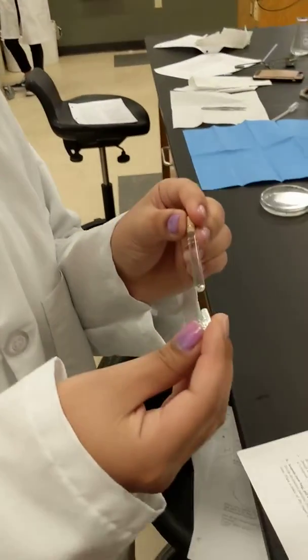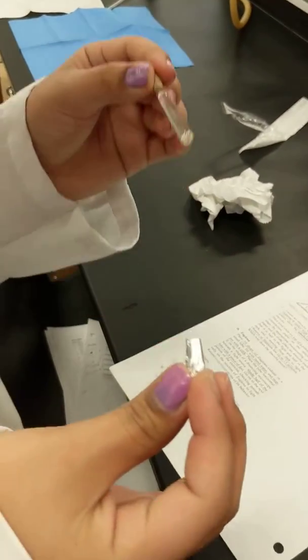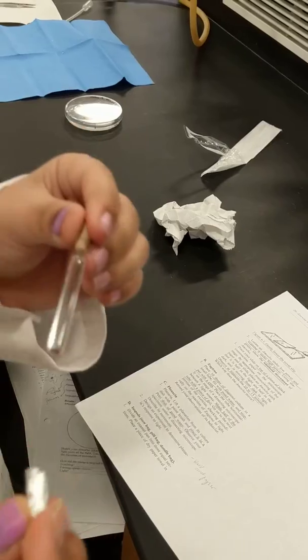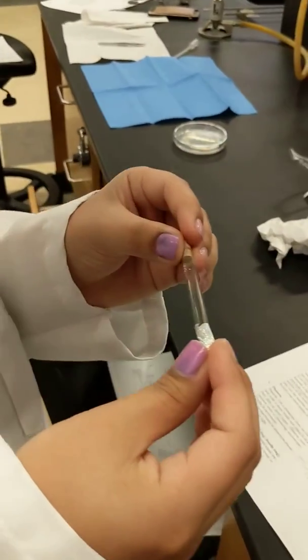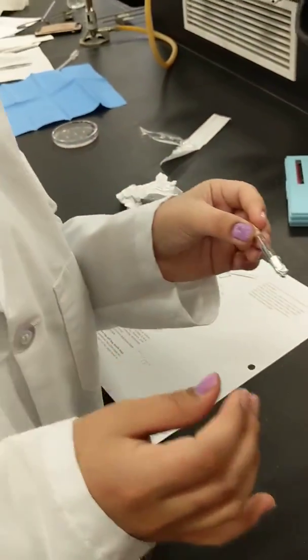Where do you think they're going to go? Probably towards the light. Why is that? Photosynthesis. Yeah, that's why. And so she has a little... Why don't you put the little sleeve on there? Okay. Thanks. My class is going to thank you very much.